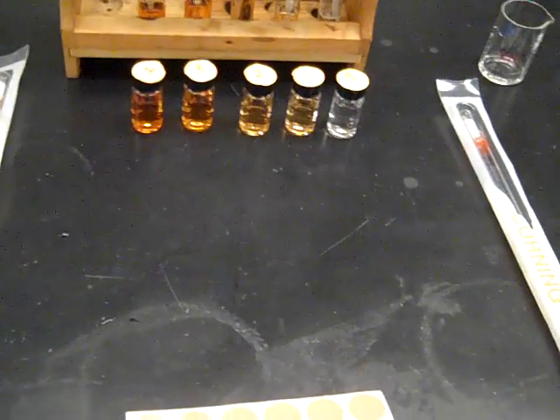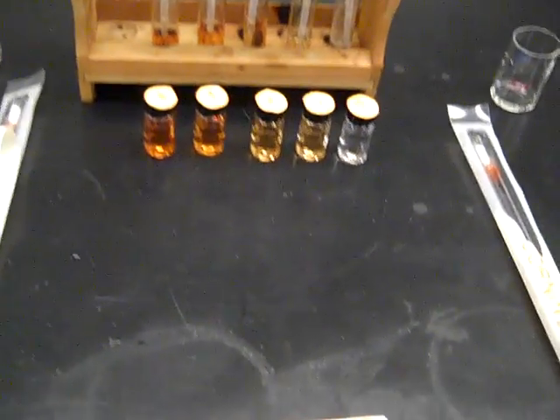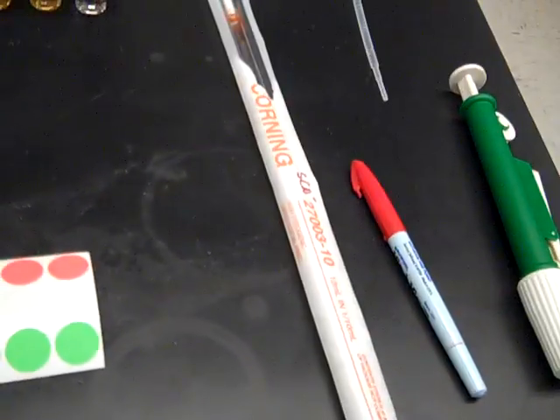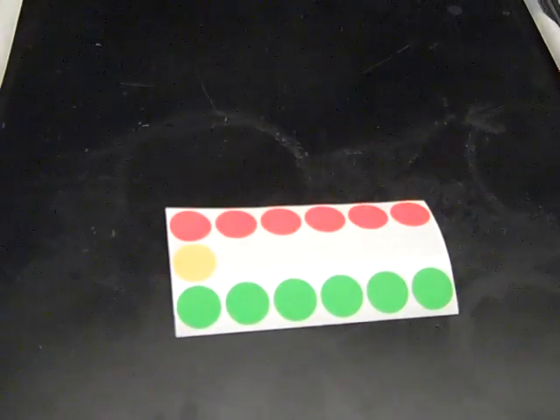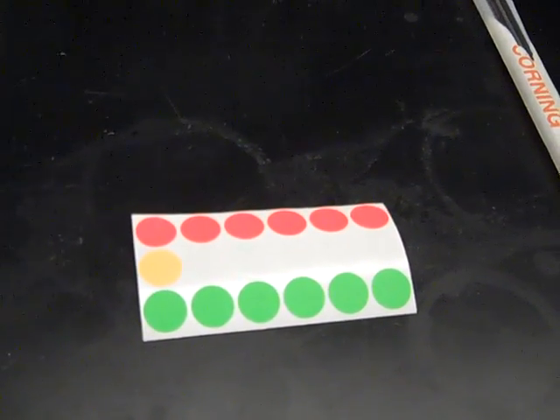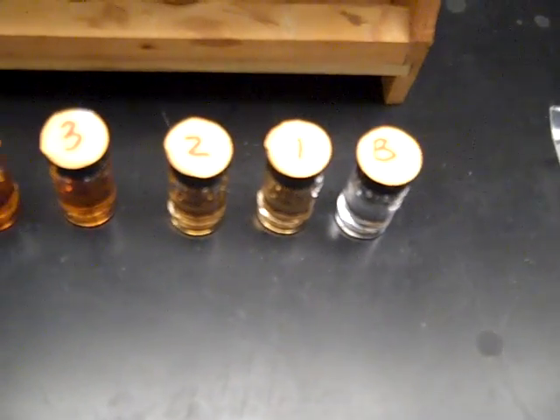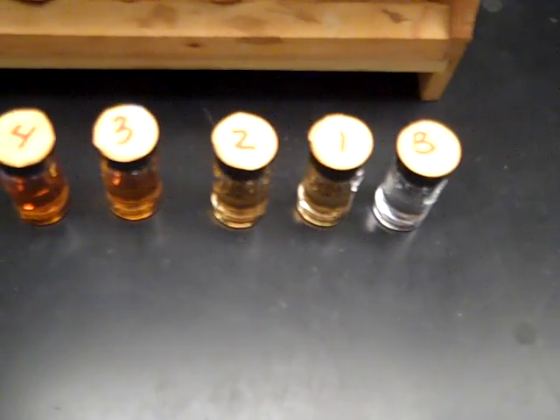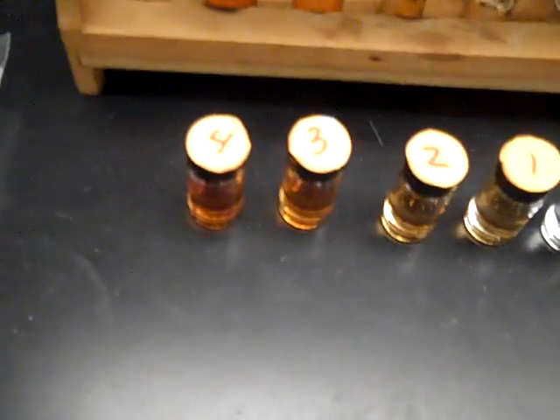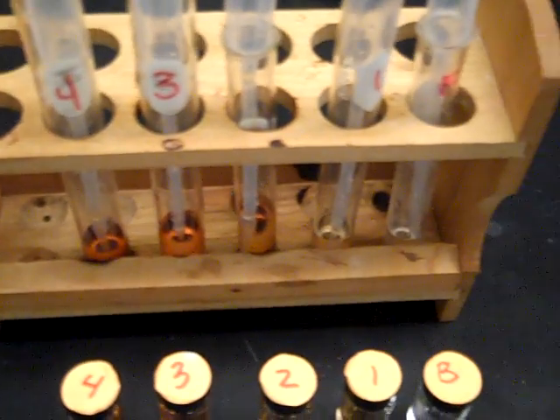In order to label your test tubes and cuvettes, you'll need a marker, just a vis-à-vis. And I got some stickers I'm going to provide you guys so you can put them on the top of each of your cuvettes so you can number them. I have a B for blank and then 1, 2, 3, 4. And also that marker can be used on the test tubes.